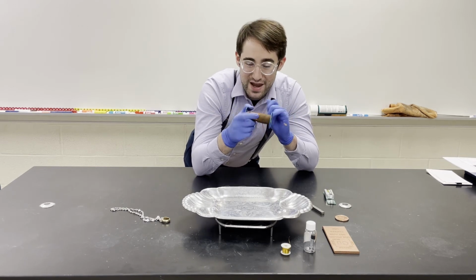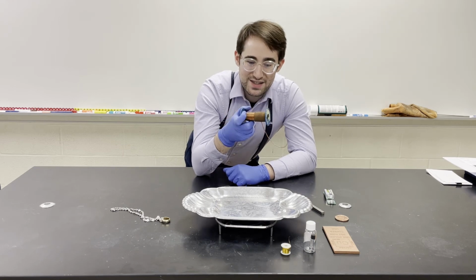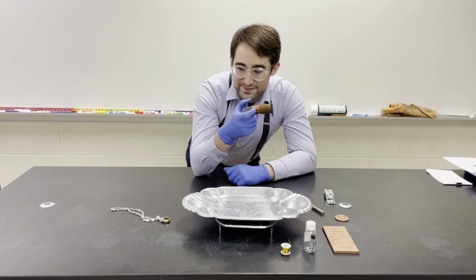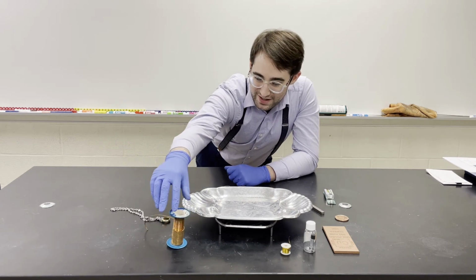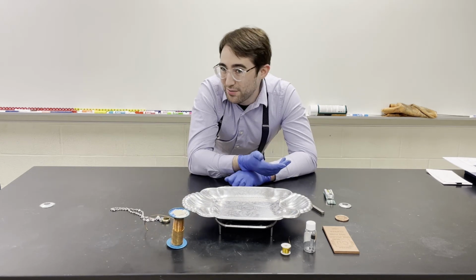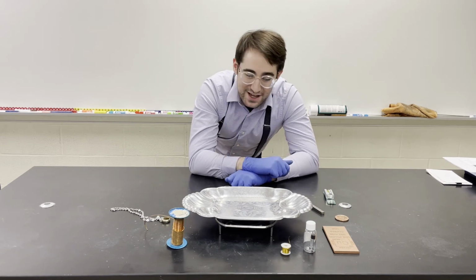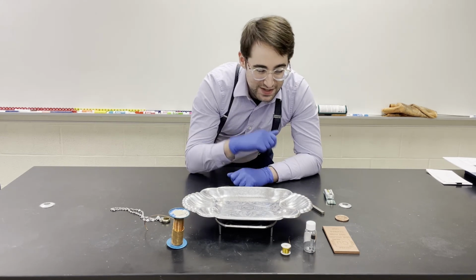So metals will a lot of times do this. They'll pick up oxygen from the air and bond, and so you get stuff that may not be as conductive or shiny as the usual metal would be. So that's something to watch out for. That does show that you're probably dealing with a metal, and also can hide some of your characteristics that it is actually a metal.